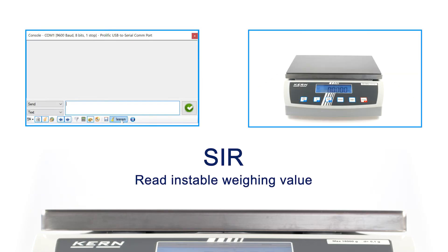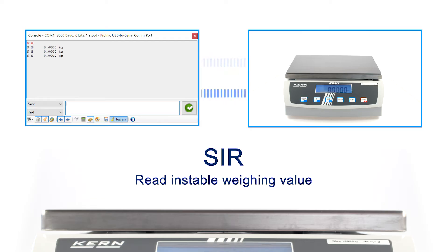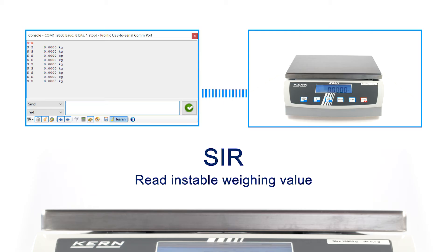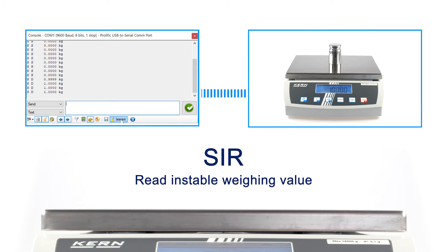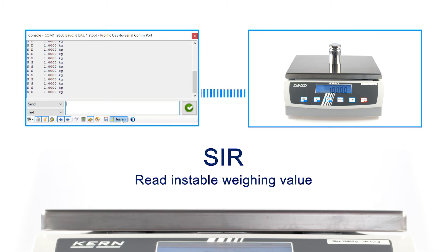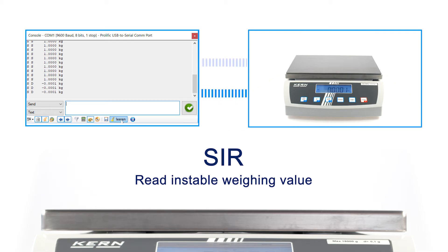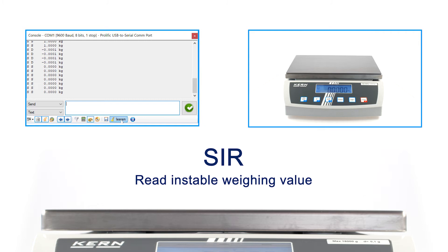The remote control command SIR activates the repeated output of the current balance indication. This is often referred to as the continuous transmission mode. As a result, the unstable weighing value is transmitted at a certain time interval. For example, you can dose liquids and get a real-time display of the weighing value on the computer. Sending S ends the continuous transmission mode.